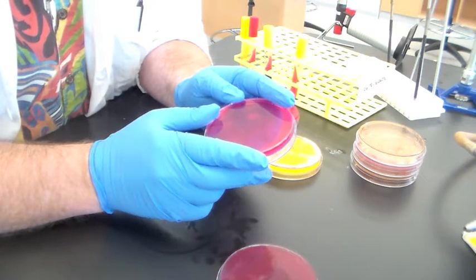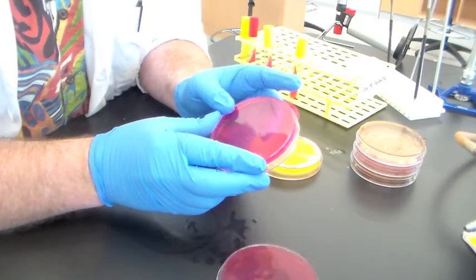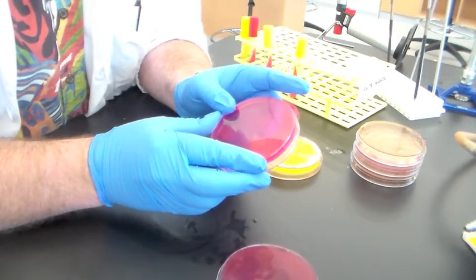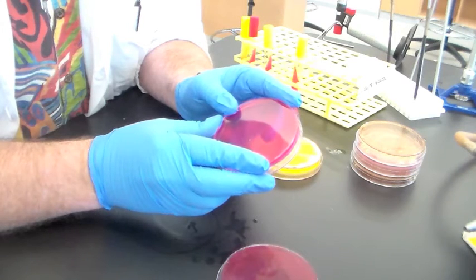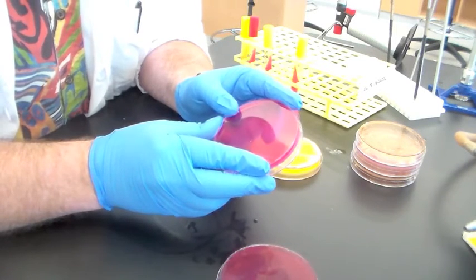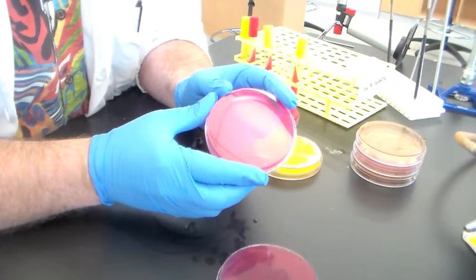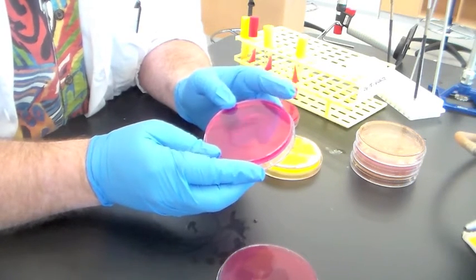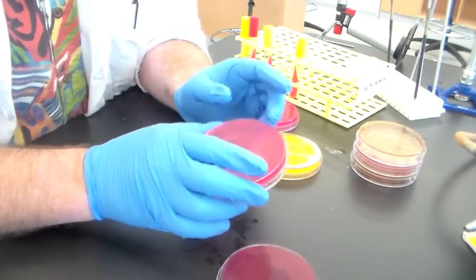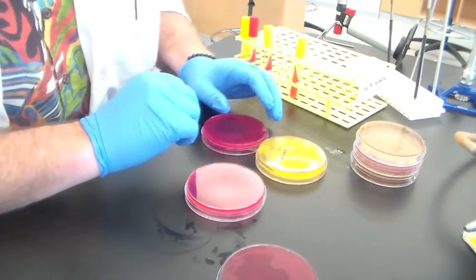Most gram-negatives don't handle that high salt concentration very well, so most gram-negatives will not grow on this medium. Staphylococci grow just fine, but other gram-positives don't so well either. So when you get your unknown, as well as streaking on MacConkey agar, you probably want to streak for isolated colonies on a mannitol salt agar plate. Hopefully your gram-negative won't grow, but your gram-positive will — if your gram-positive is staphylococcus. It's selective because of the high salt concentration, and it's differential based on the ability to ferment mannitol.